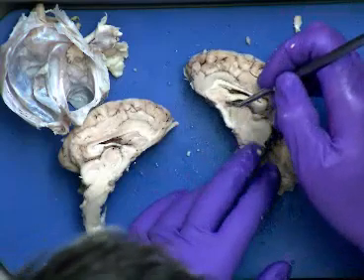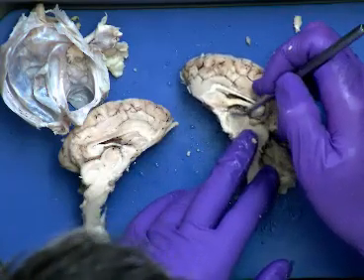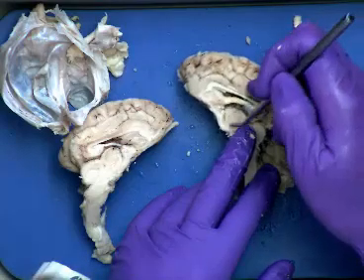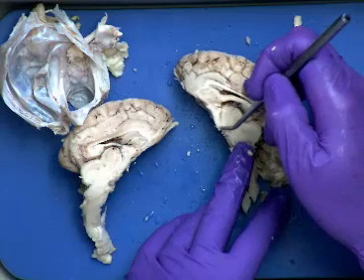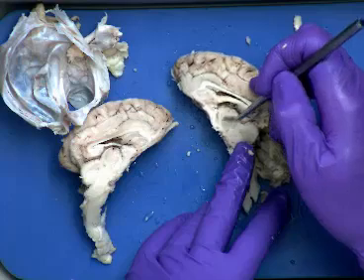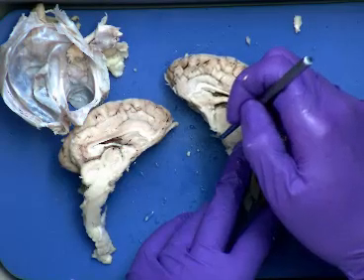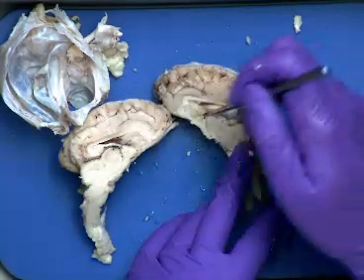And this area right here is going to be our thalamus. So our thalamus is going to be the rounded area that we see in here. The hypothalamus would be just underneath it. It's not quite as large in this particular example, but this is going to be the thalamus, the round area, and the hypothalamus is going to be underneath it. And remember that pituitary gland was going to be a little bit darker glandular structure underneath that, but it's separated with our dura mater there.